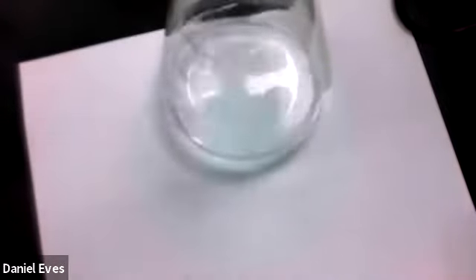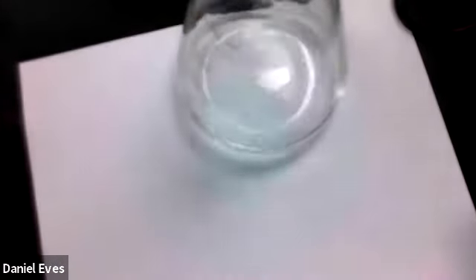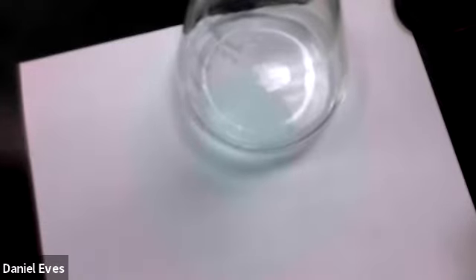So here we go. We're going to add our base to our acetic acid solution, and the initial amount of acetic acid was 5 milliliters. And we're going to see if we can calculate how much acetic acid there is in that initial 5 milliliters. So even though we've diluted it to 50 milliliters, there's still just the acid in that initial 5 milliliters. So our calculations are going to be based on that initial 5 milliliters. All right, so here we go. Adding the base.